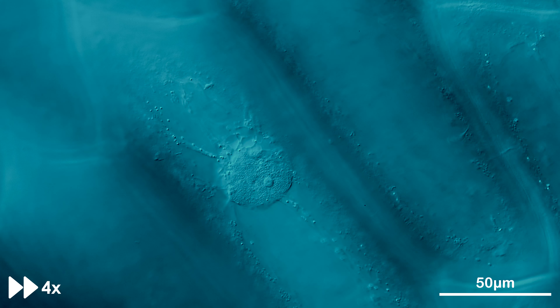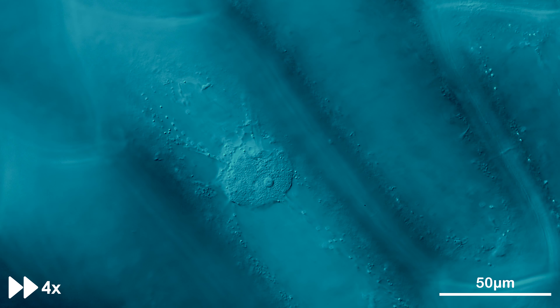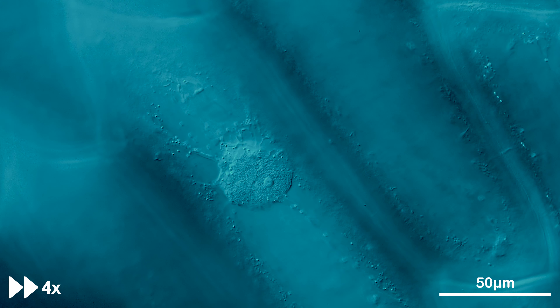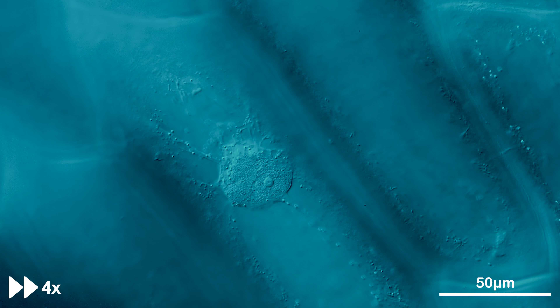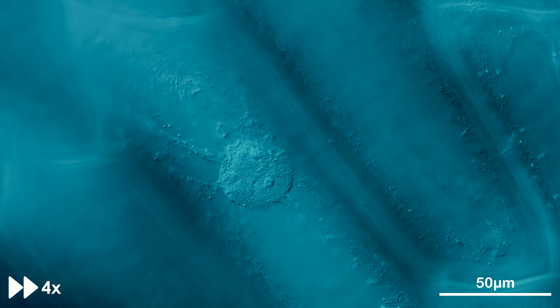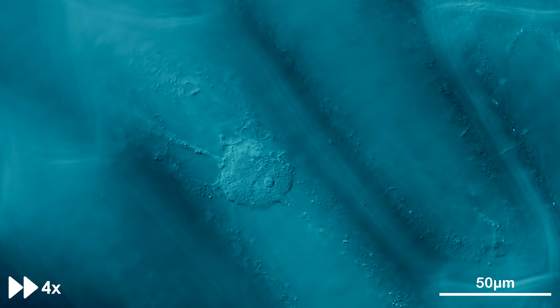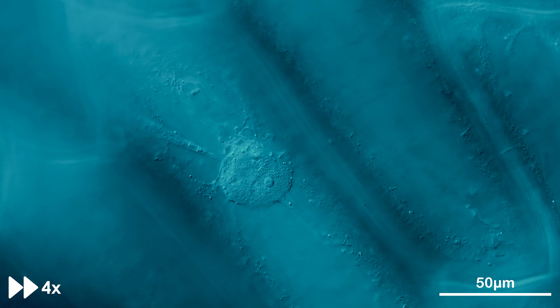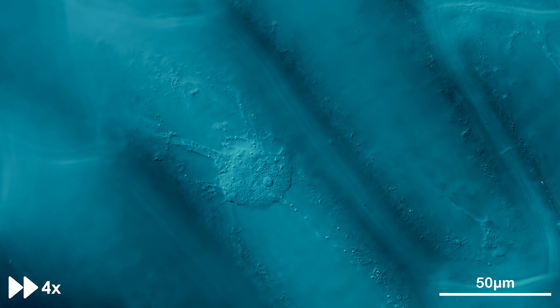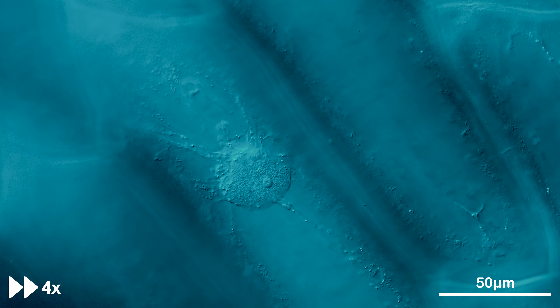Onion cells are the typical study object in schools to observe organelles and mitosis, as it is very easy to prepare slides for observation. What is often overlooked, due to poor illumination techniques and therefore reduced contrast, is cytoplasmic streaming and organelles.